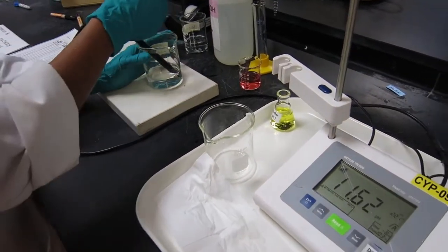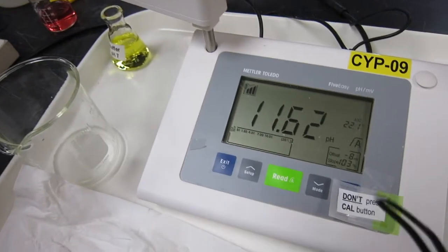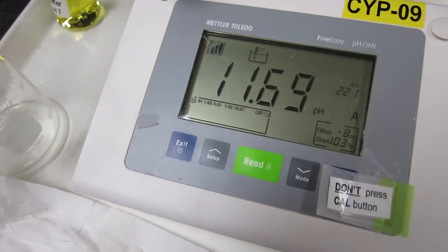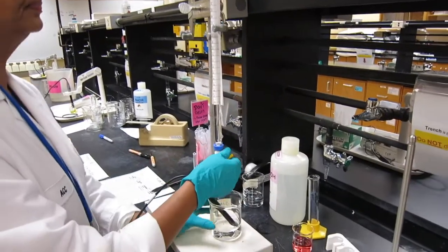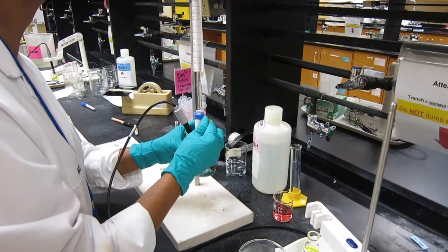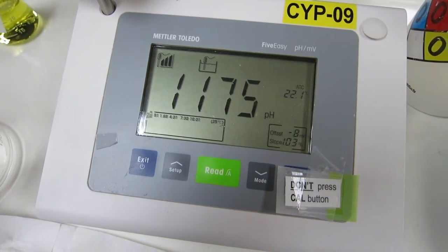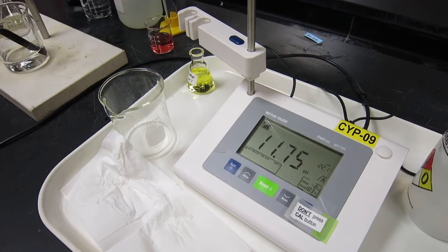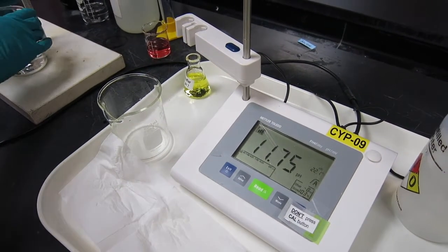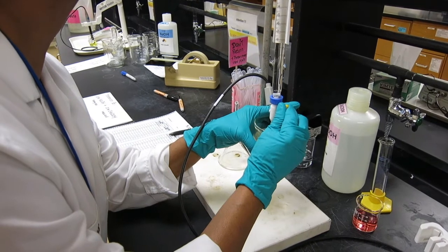At 29 mL the reading is 11.69. At 30 mL it's 11.75. Now we add 5 mL, for a total of 35 mL going into the beaker.